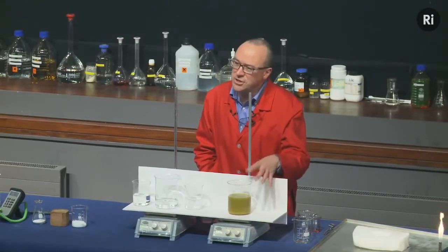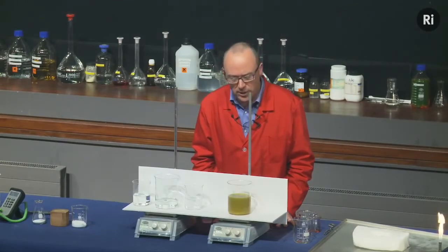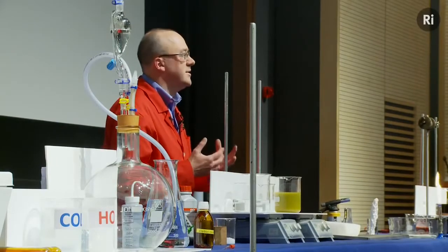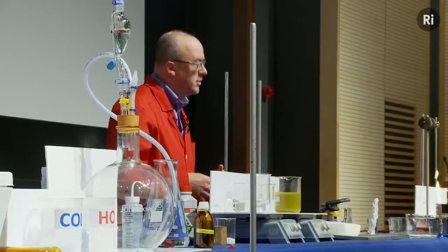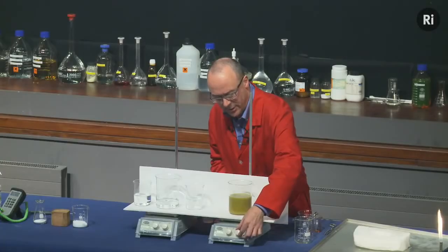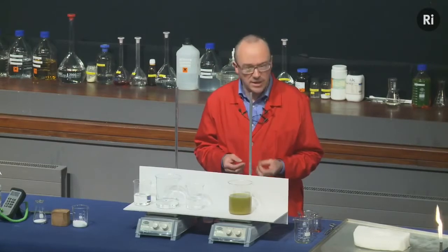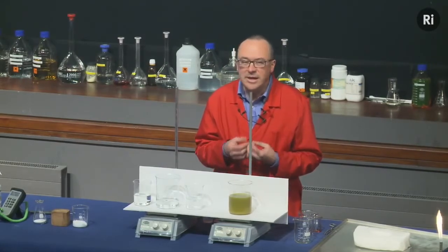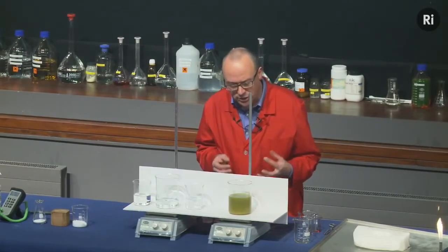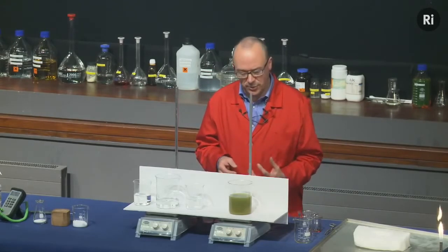Now, there's a rather interesting story behind this reaction. It was first discovered in about 1951 by a Russian chemist called Boris Belousov. And he was trying to study the way citric acid behaves in the human body. And so he was mixing various materials together in a beaker, and he discovered some very interesting colour changes, and in particular he discovered an oscillating chemical reaction. That is, a chemical reaction that went through a sequence of colour changes and then came back to the starting point.